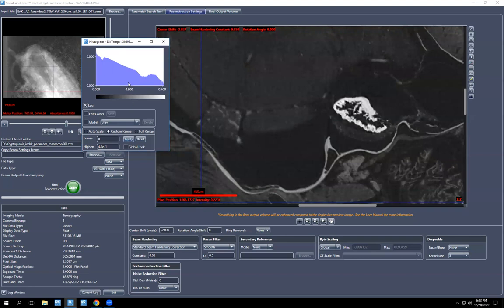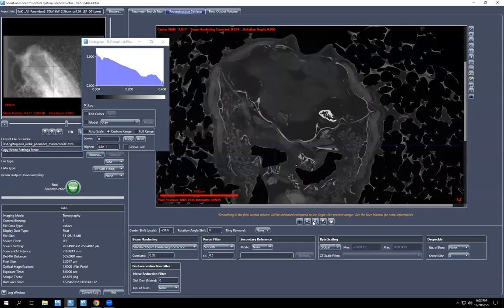It's somehow, in a way I can't fully explain unless it just changes the scale, seems to not only add this little bit of data at the end, but almost gives you a higher, I don't know how to explain it, but a higher quality image. Your gray values haven't really scrunched together too much, so you're spreading these values out over the data, and it just looks nice.